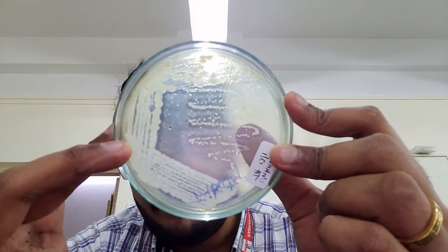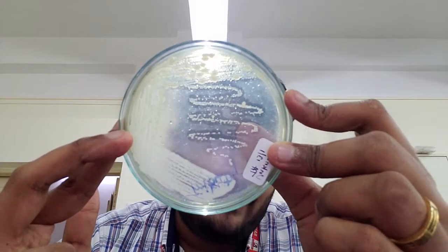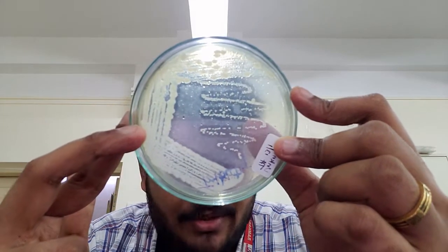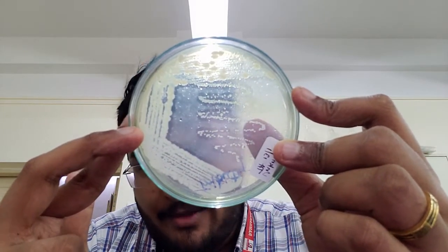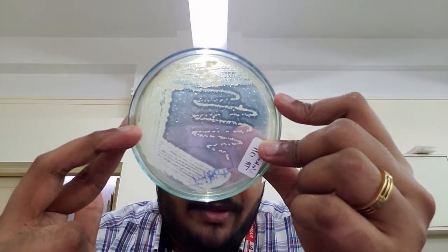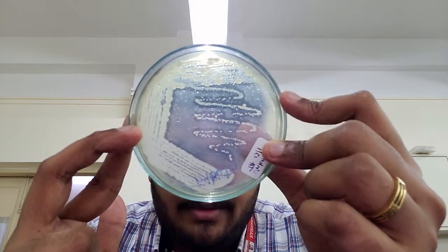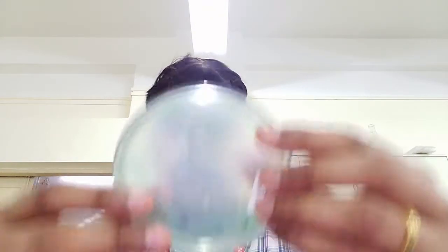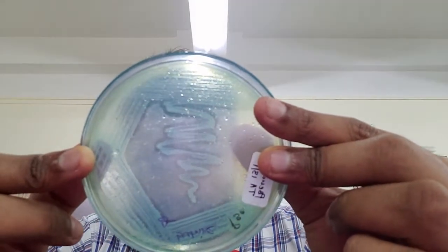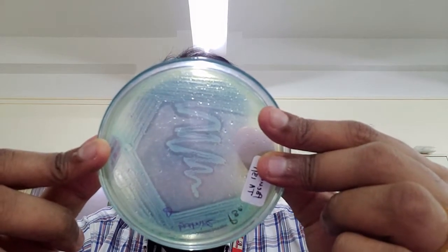This is an unknown strain — I wanted to look for a very good lipase producer, so I exposed this plate to air and isolated a few strains. It still looks to be a mixed culture, but I was trying to isolate from that air-exposed plate to see whether we have any lipase producer or not. You can see that there is indeed good clearance visible on the tributyrin agar.